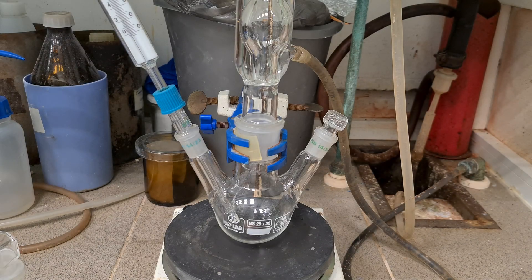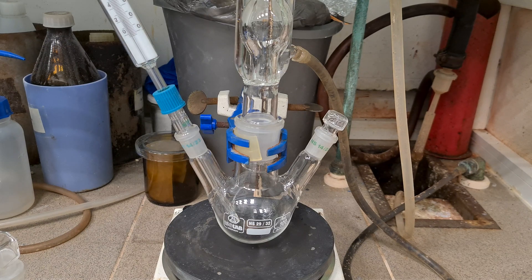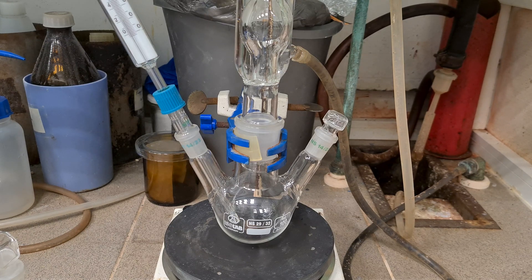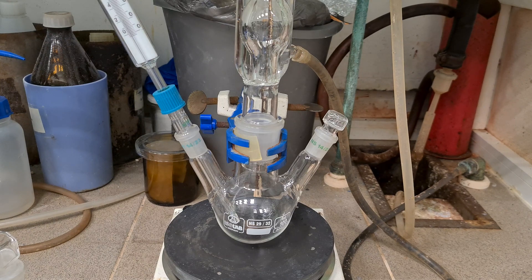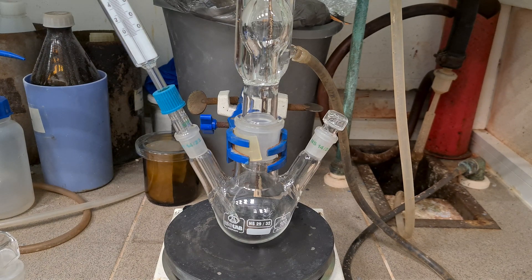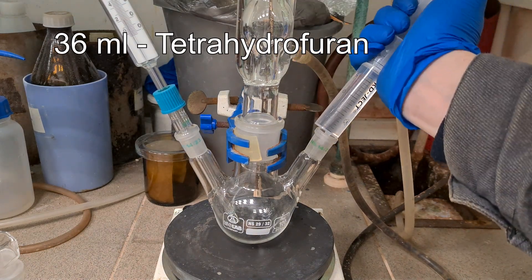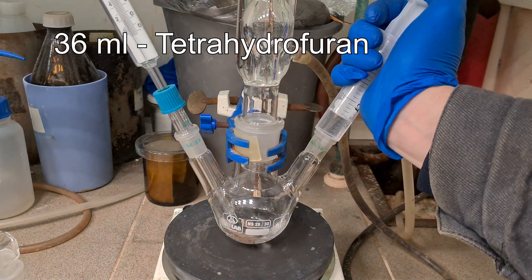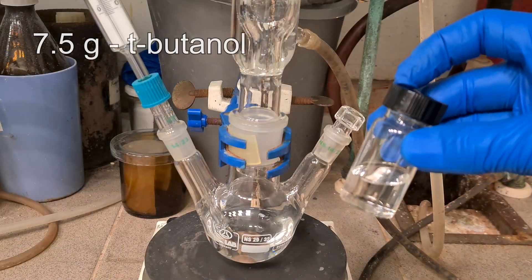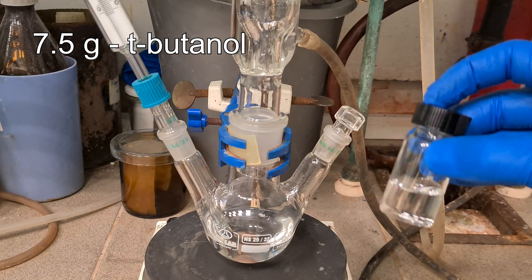First of all, I have made this setup consisting of an oven-dried 100 ml three-necked round-bottom flask, reflux condenser, stir bar, and thermometer. The remaining neck will be used for an argon balloon as well. Now add 36 ml of freshly distilled THF distilled with lithium aluminum hydride, then add 7.5 g of t-butanol partially recrystallized to remove excess water.